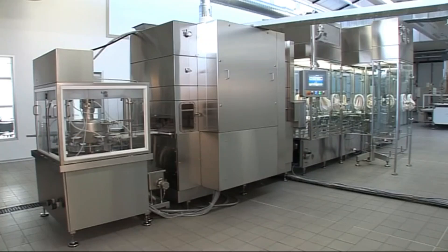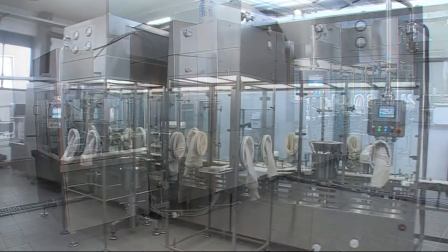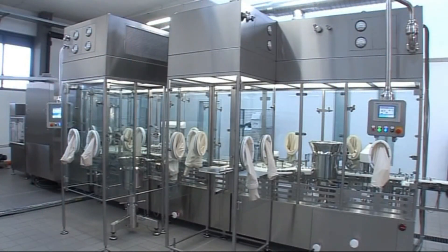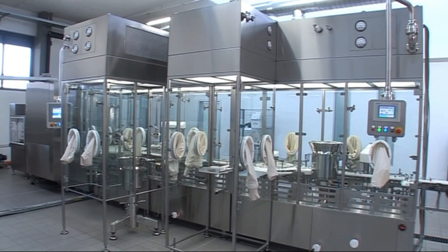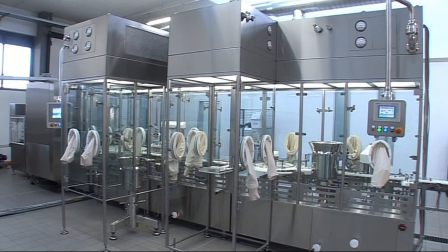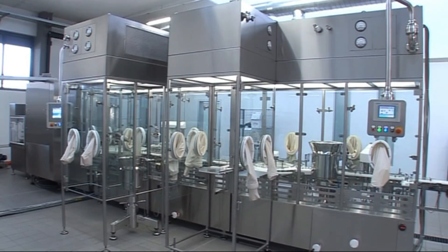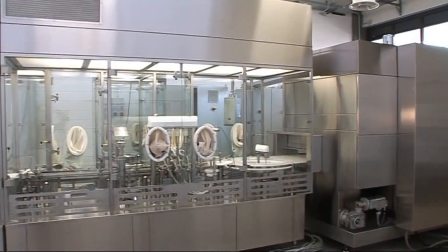Restricted Access Barrier Systems, RABS, and Isolators are both used in pharmaceutical manufacturing environments to provide controlled environments for aseptic operations. However, they differ in design, operation, and application.